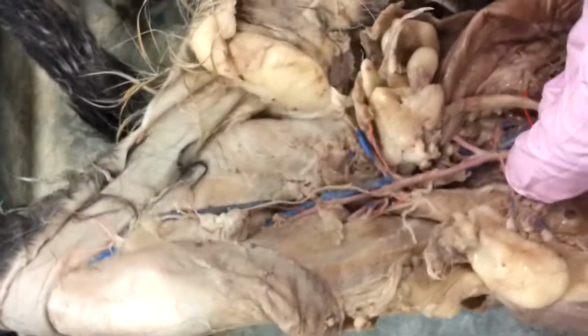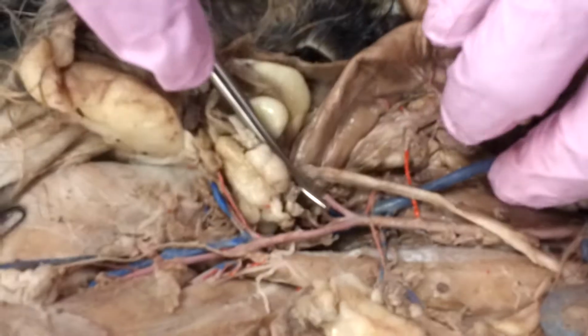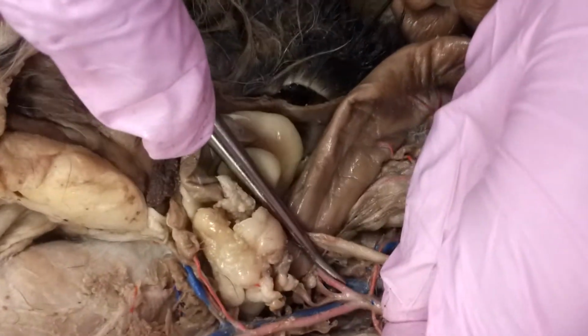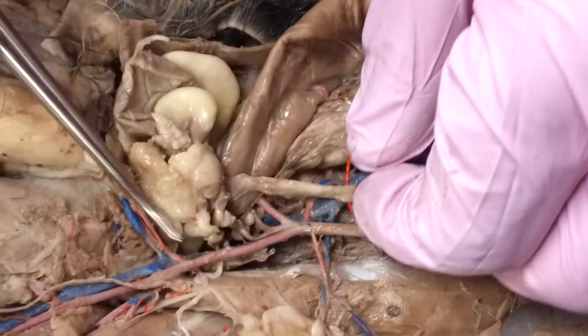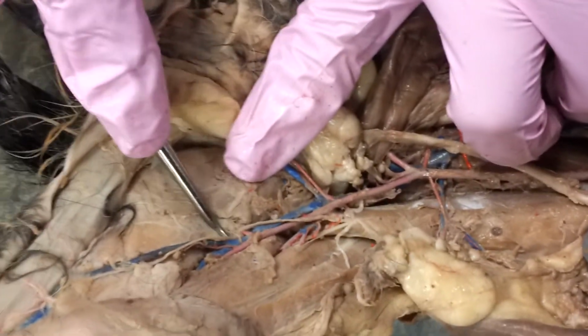So, one more time. And you may be asking, how am I possibly going to know the difference? Well, I'll tell you how. If I'm going to test on the veins, and I'm going to use this cat, I'm going to tag right by that bifurcation. So you know it's got to be the common iliac vein if it's by that bifurcation. If it is right in the middle of the thigh, then it's going to be the femoral.